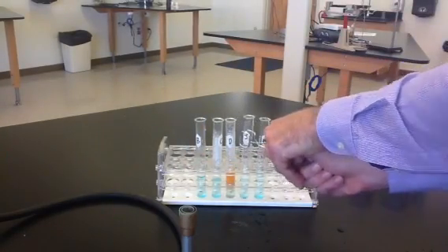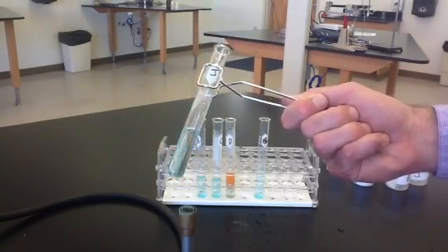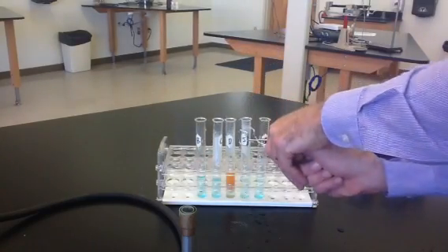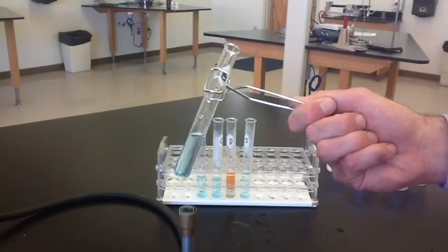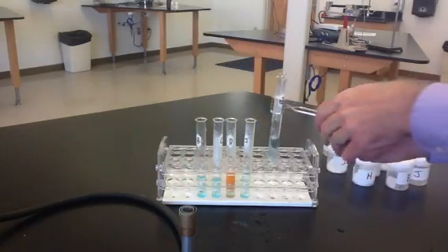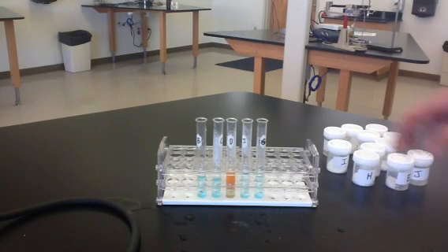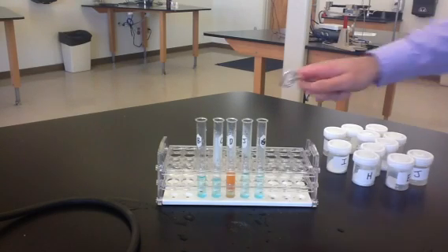We'll check J. No color change occurs with J. And then with G — no color change occurred with G either. So the only one that had a color change with the Benedict solution and heat was D. Solution D can be identified based on the results of this test.